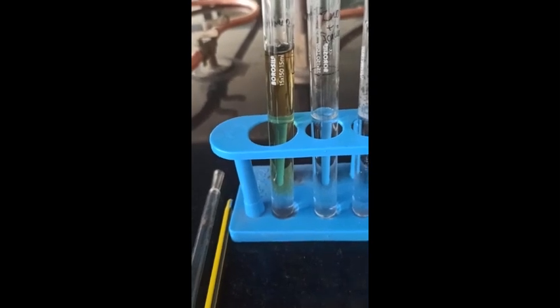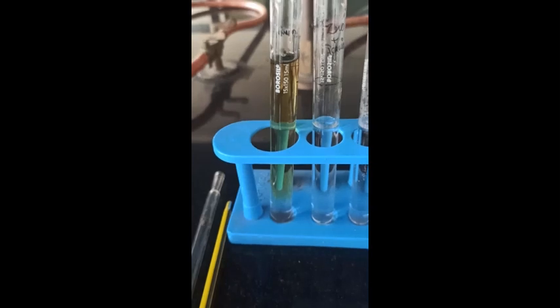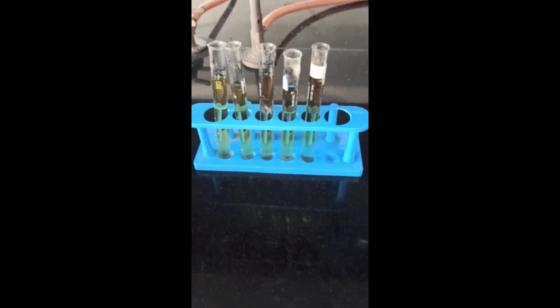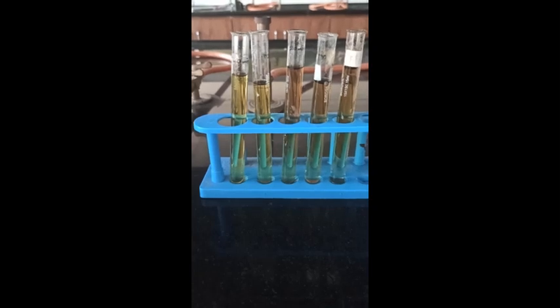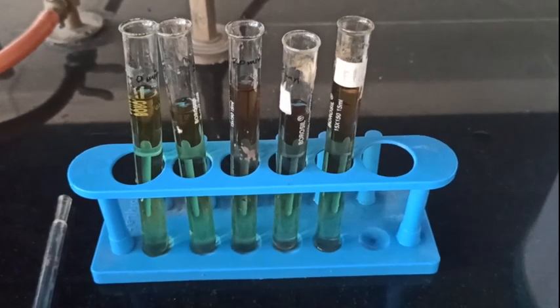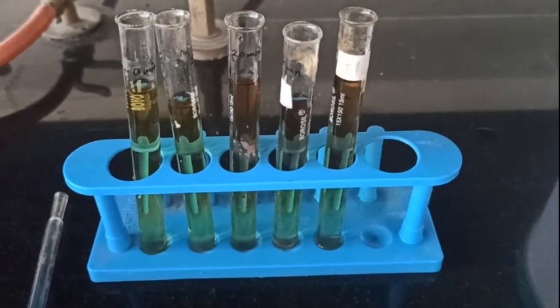This is the previously prepared ferric nitrate solution and now we add 5 ml of ferric nitrate solution into the samples withdrawn at 10 minute intervals. As the ferric nitrate solution diffuses into the sample, the sample changes its color to bluish yellow. We will be measuring the absorbance of samples using a suitable instrument at 547 nm wavelength.